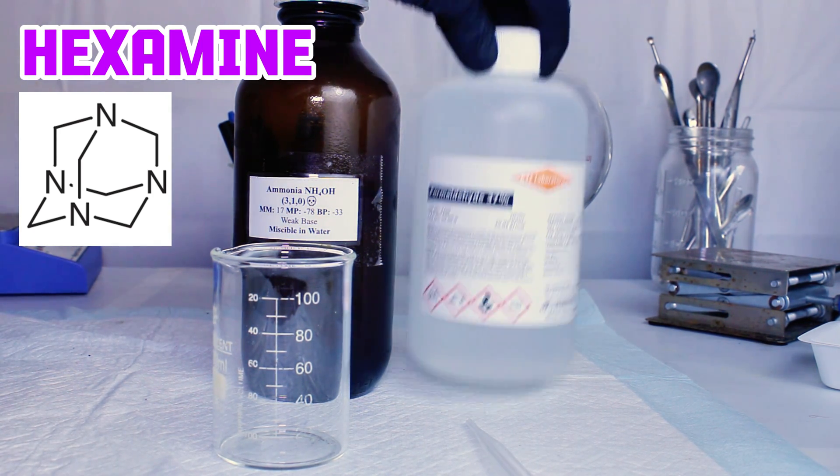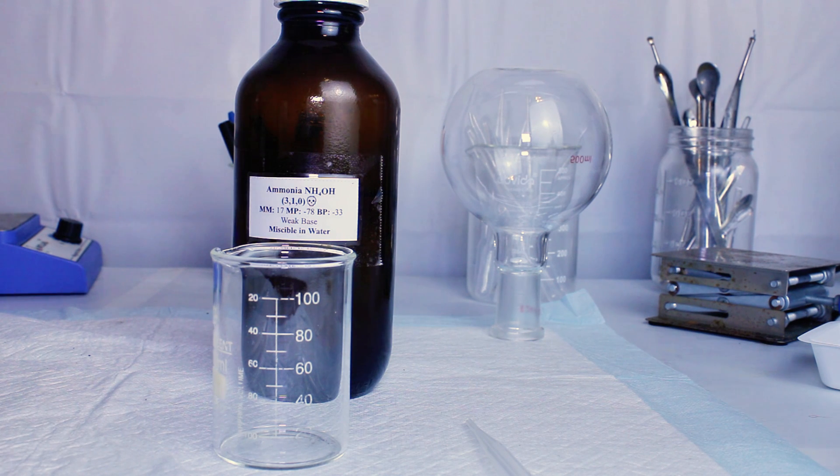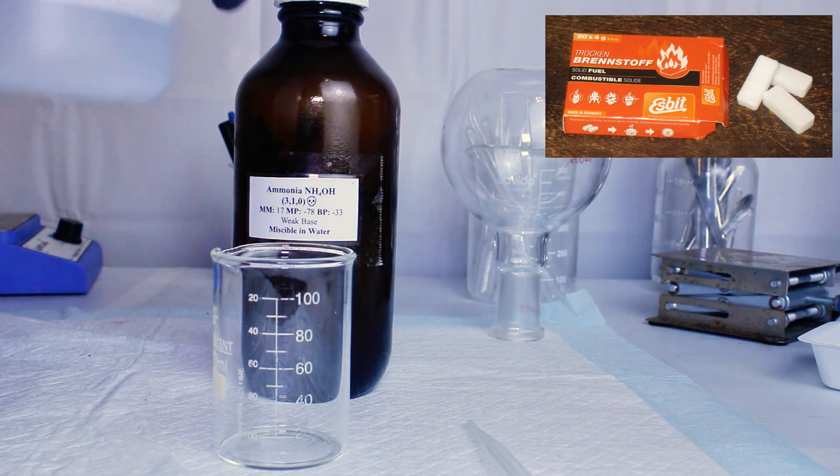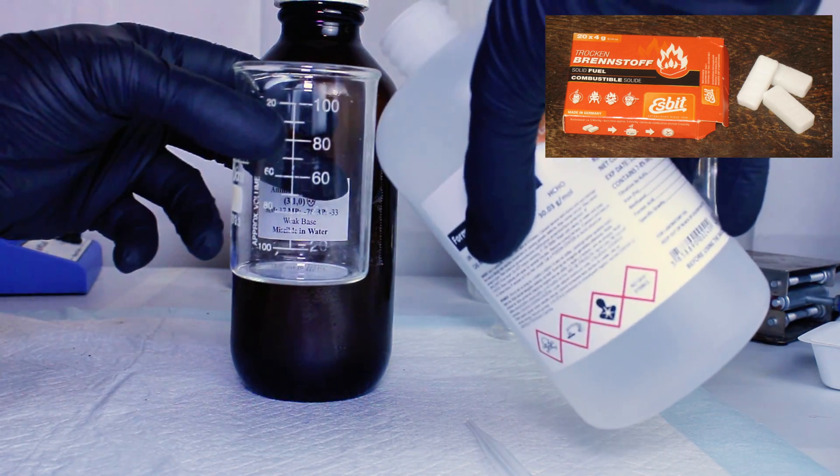Hexamethylenetetramine, or hexamine, is an interesting chemical with some pretty cool properties. Historically it's been used as an emergency fire starter, as it burns very clean producing no smoke, and has an extremely high energy density.